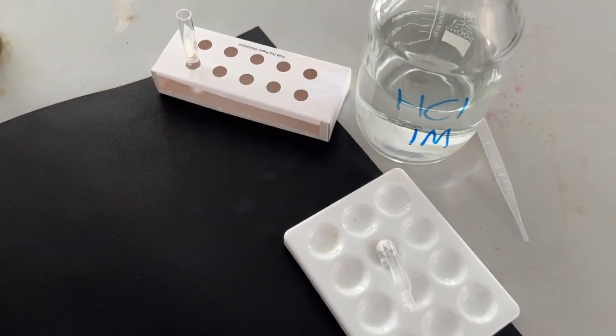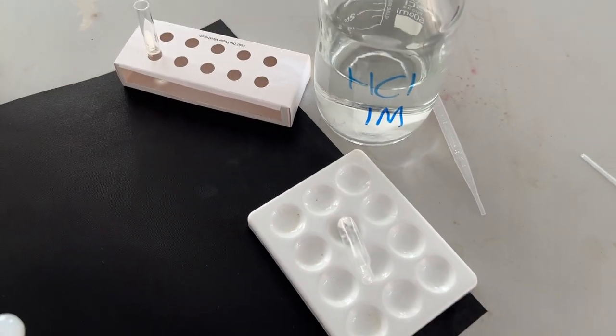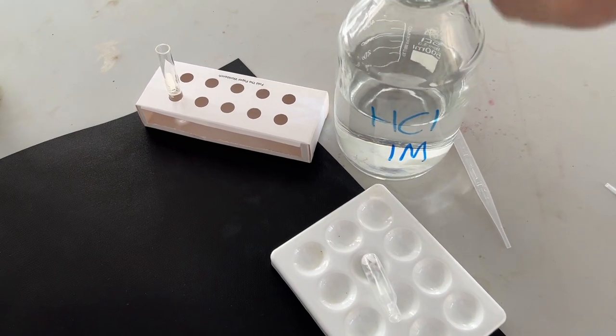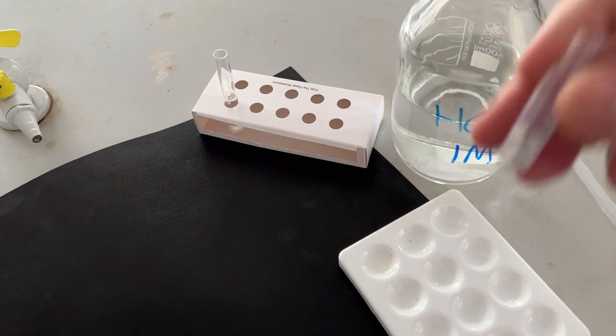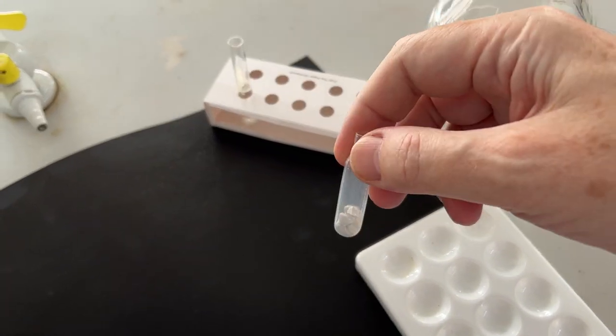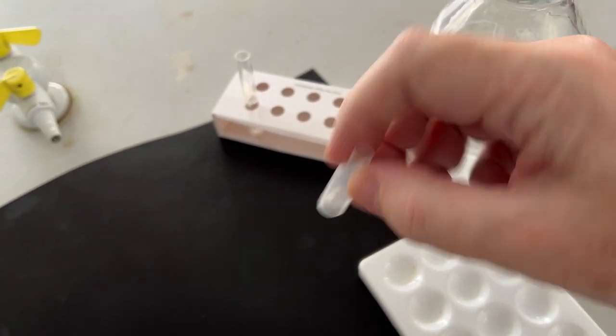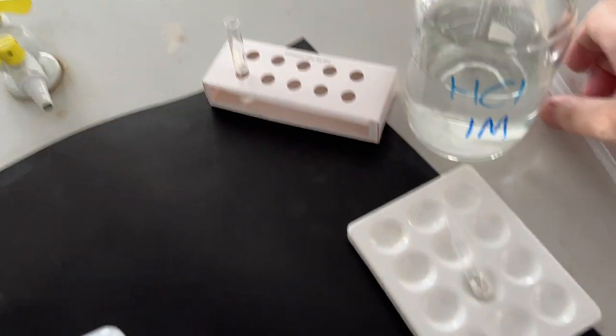Here's an alternative small-scale experiment where we've got some hydrochloric acid. What we're going to do is pipette it into the dropping pipette bulb which has some small marble chips inserted into it.